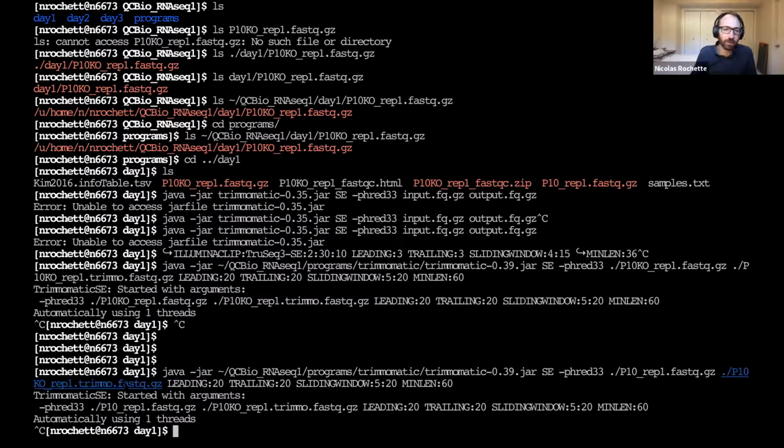And so in that case, it's not really going to be very serious, right? Because I'm just going to realize I'm now missing the file for the second sample, and something went wrong, and I may just start again, remove all the files, start again. Or I could do something else, which is, I'm missing the second file, so start again with the command line, copying and pasting everything, and then updating the file to work on the second sample. But then if I did this, what would have happened is that I've actually duplicated the second sample and removed the first one.